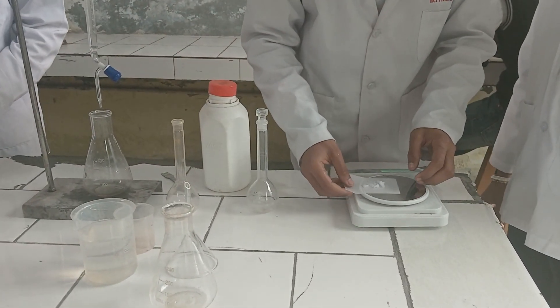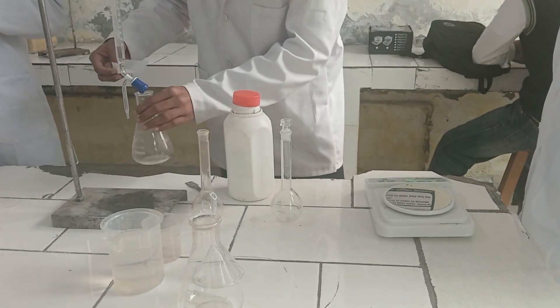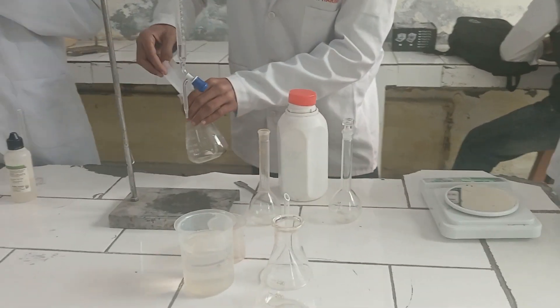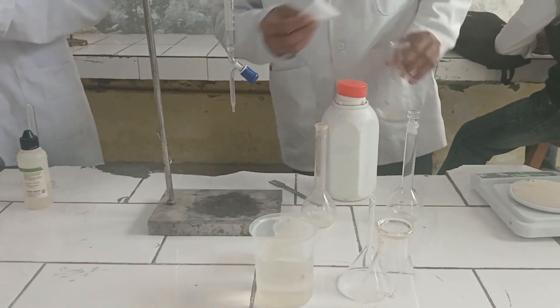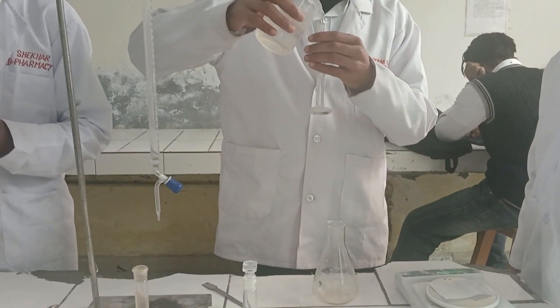Here students are doing the same. They are transferring it to the conical flask, adding 20 ml of water to it.